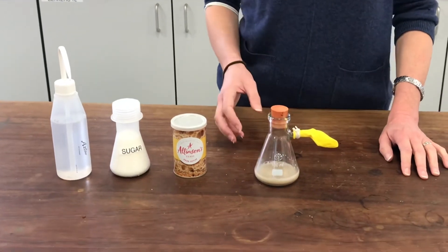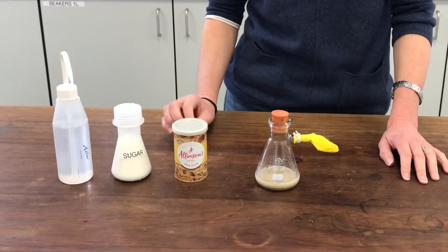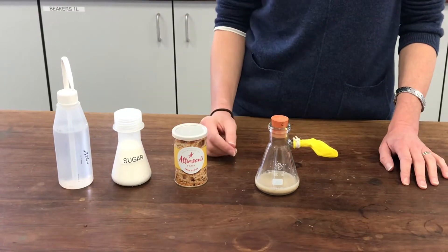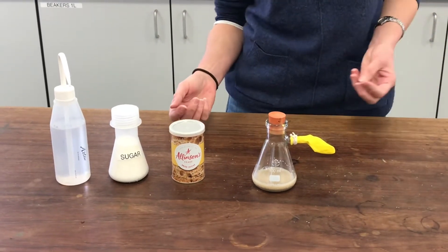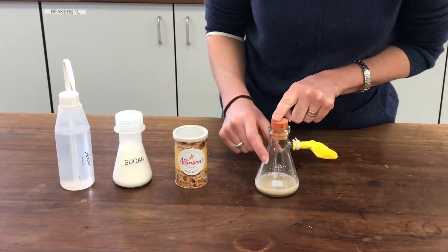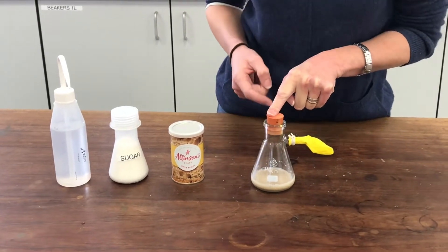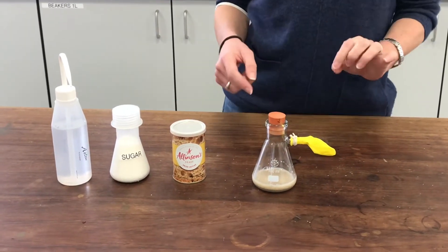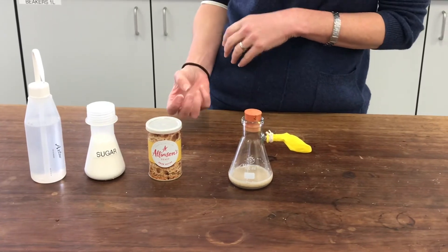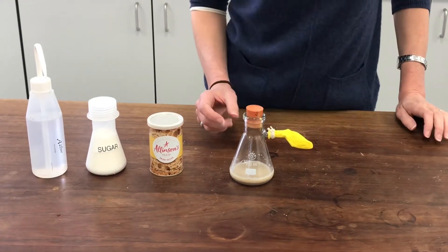Yeast is a microbe which feeds off the sugar effectively and replicates, and in the process of doing so, it produces carbon dioxide and water — up to a point. Once it's finished using all the oxygen in the flask, it will start to respire anaerobically, and the by-product of doing that is alcohol.